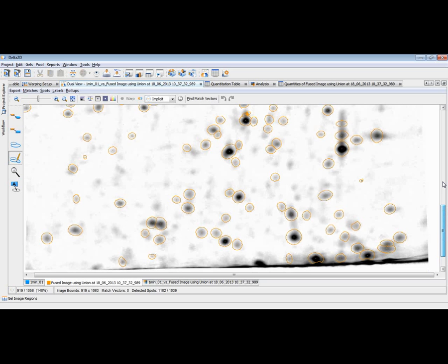And then you scroll to the right, improve the pattern there, scroll down a little bit, check the pattern here, like this, scroll back to the left, scroll down again, and then to the right again. And once you have scrolled through the complete image, you could say, now I'm done. The spot pattern is looking like it should be, and then you can transfer that.